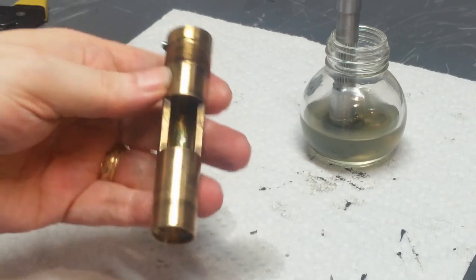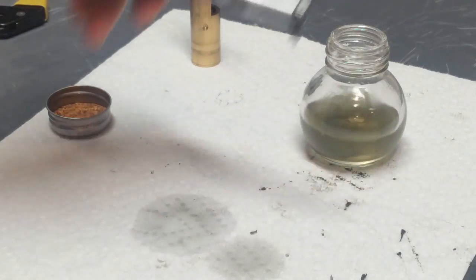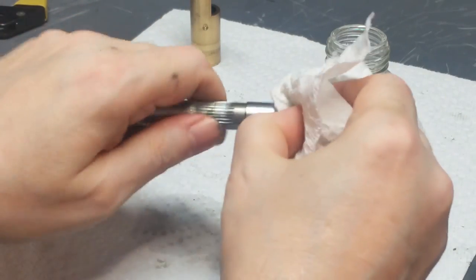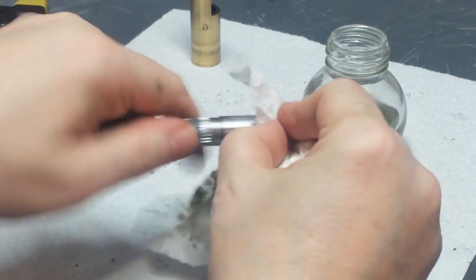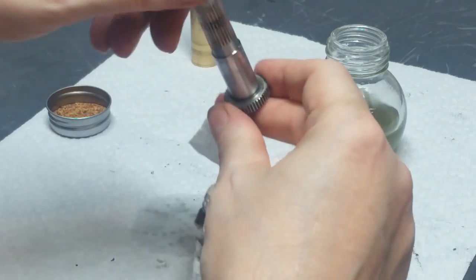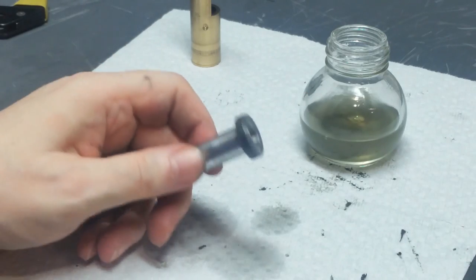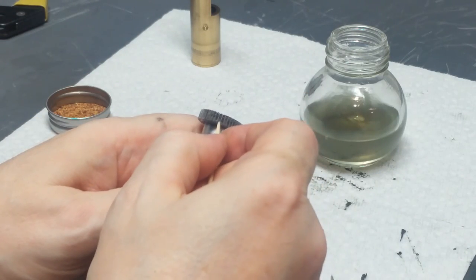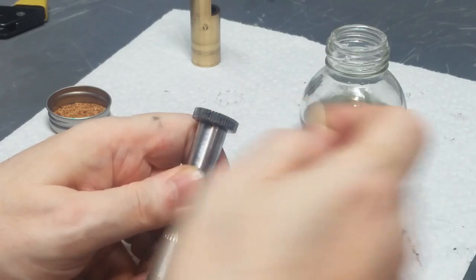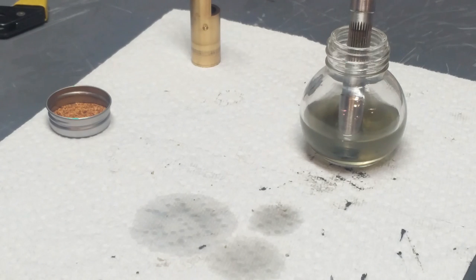I'll continue cleaning this off camera until it's done. No reason to make you watch that. That's pretty tedious. And probably the same thing for this one. There's grease in all the teeth. I'm going to go off camera and go through tooth by tooth and scrape those out until that's clean, and do the same thing on this end. But I'll be back when it's all clean.